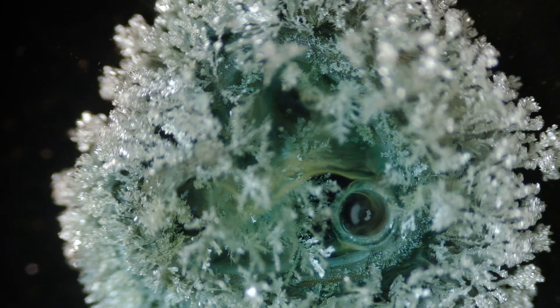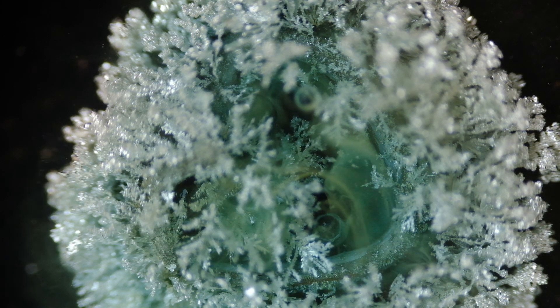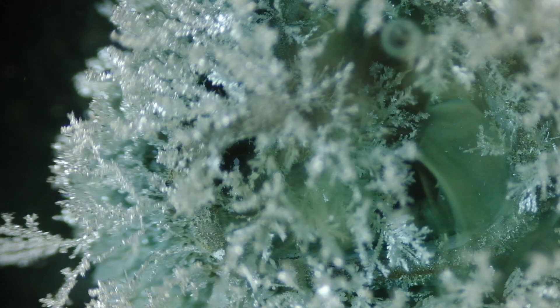The two cool and unexpected things. Number one: look at this end shot. The reaction is almost stopped — there aren't very many new crystals being formed — but then an air bubble rises, and a moment after, another spire of silver erupts from the structure. Why is this? Well, the reaction is stopped because the copper has been almost all used up — we call that the limiting reagent. The silver ions in solution don't have anyone to take electrons from. But in this case, it wasn't totally used up. The bubble must have been protecting a little bit of copper metal that hadn't reacted yet. So when it rises, that copper metal is exposed, and a little more reaction happens, forming the silver spire you see on the left.